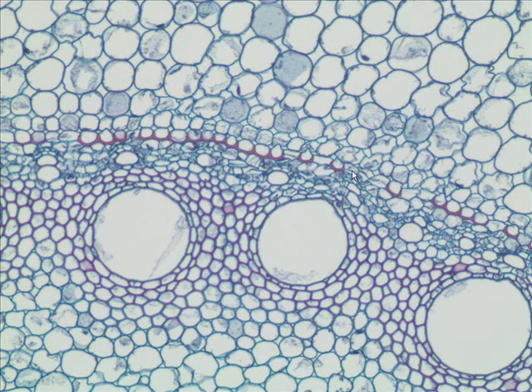And so, what is this layer of cells called that has this coating of suberin? It's called the endodermis. Inside the endodermis is another crucially important layer called the pericycle. Where have we heard about the pericycle? What develops from the pericycle? Branch roots. And then, of course, these big guys are the xylem. Where's the phloem? That little patch right there is phloem.